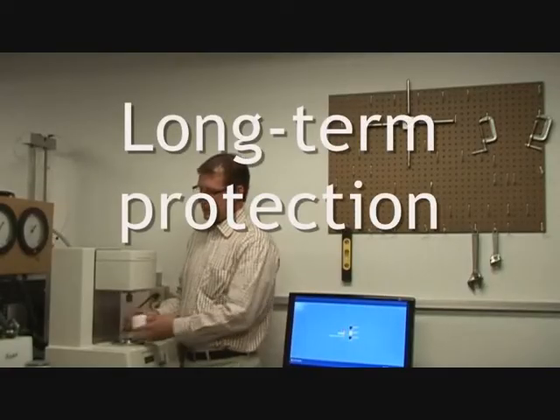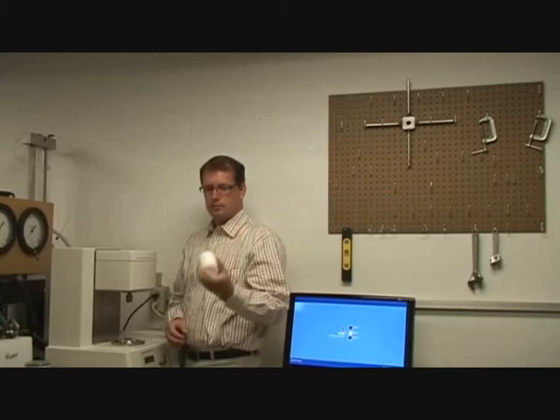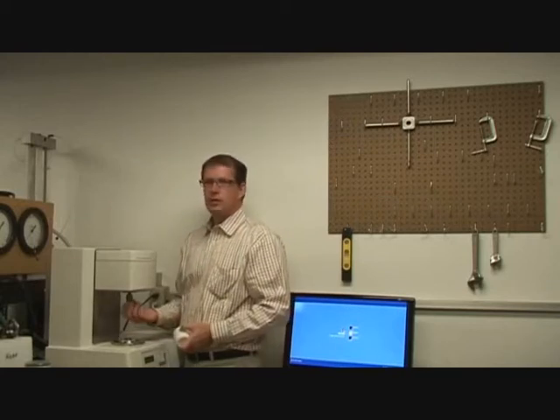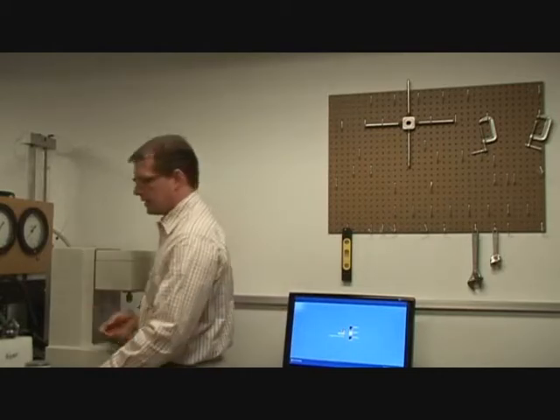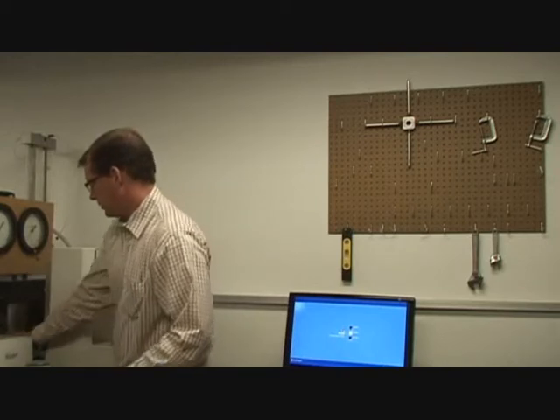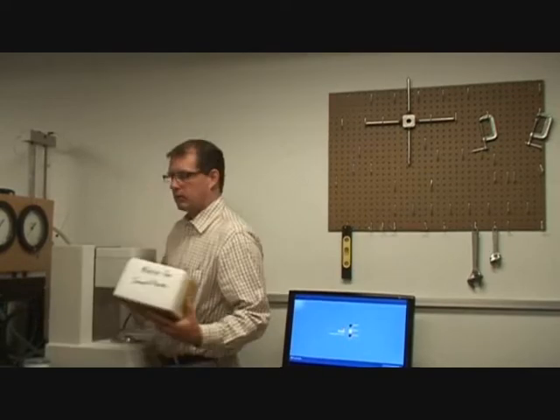What this cup is, and I'll take it off now, is just a little Teflon ring. It's got a hole in it, right? So you could reach your fingers up there and spin the motor. So it's not as good a protection as, say, this foam block. But it's a temporary one where it's just being left, okay?